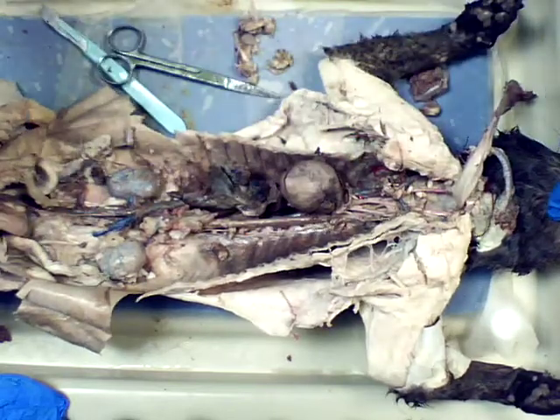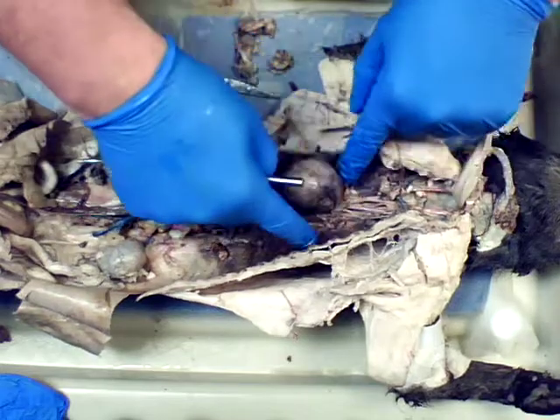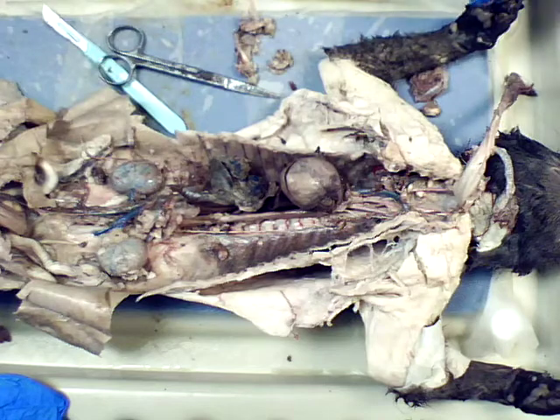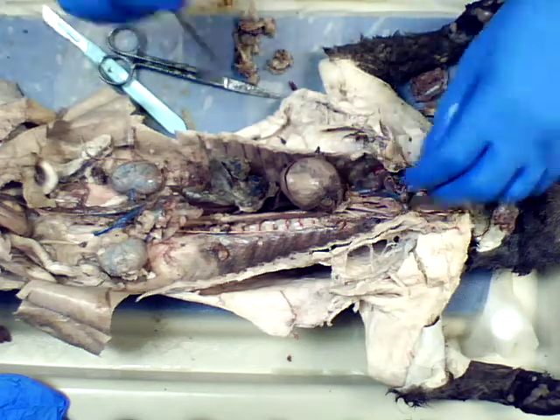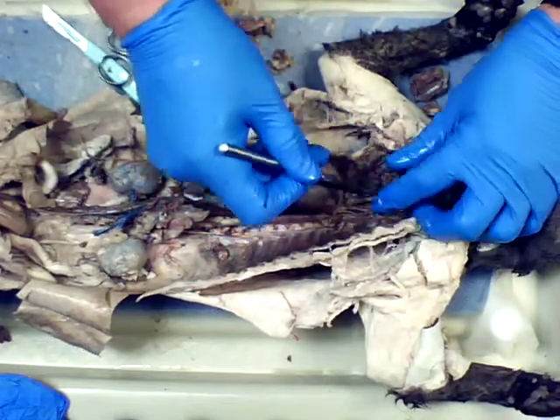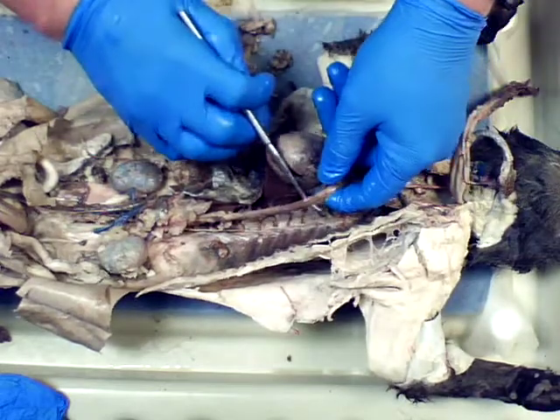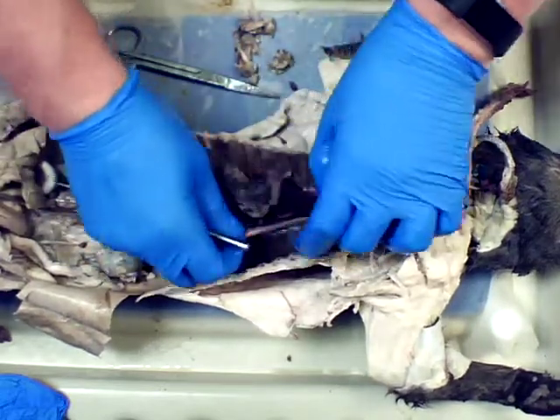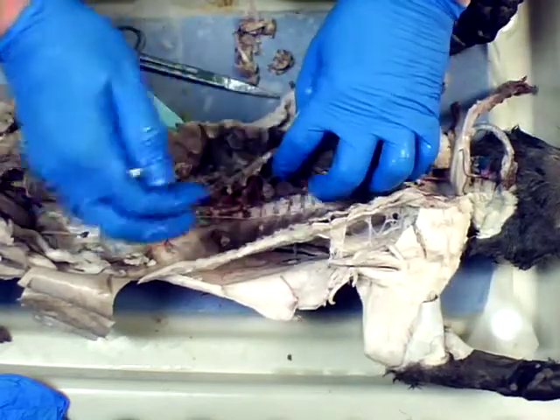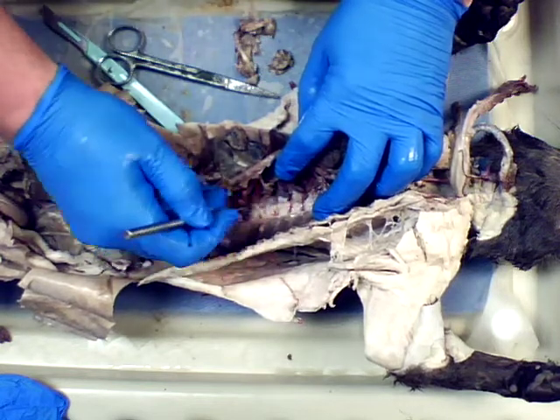So again, from head and tail, follow the blue back to the heart, from into the lungs, follow that, and then follow the pink and red back out to the body itself. Okay, so again, arteries, pinkish color, veins, blue color. Okay, and again, the aortic arch is right here with the descending, one of the things you never got to see with the model. And then you can see here all the capillary, all the red strings that are holding on, all that capillary. You've got some vein back here that I just broke that goes with the spinal cord.